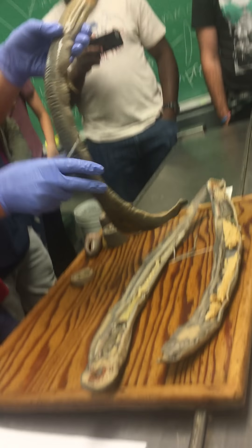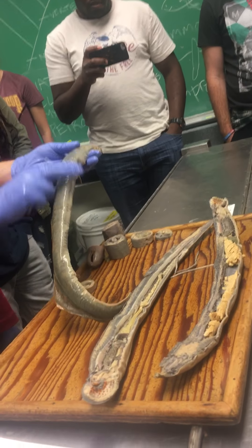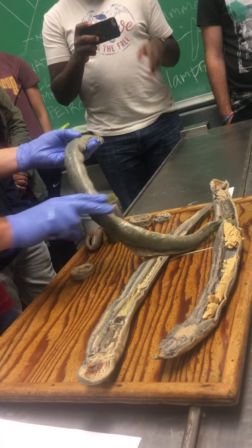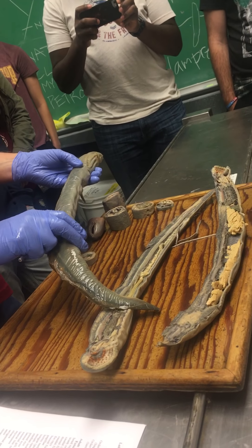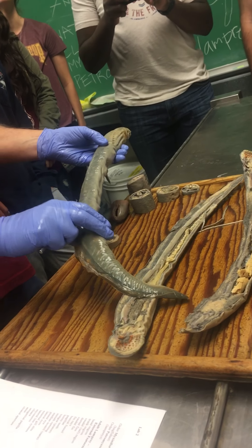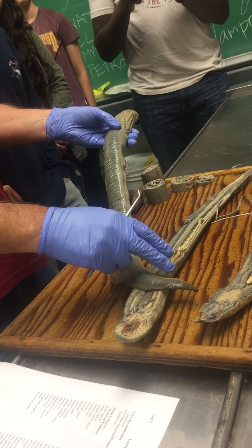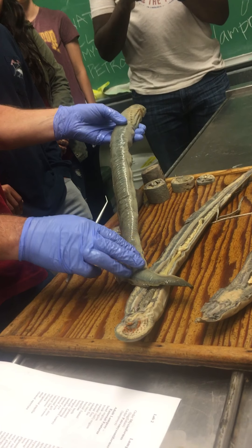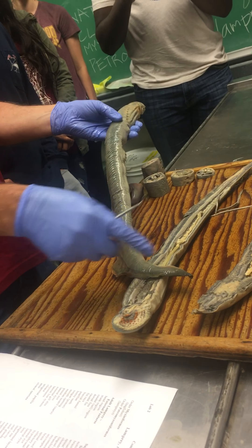The lamprey has a head region which goes all the way to the back of the gill slits. The branchial region is part of the head, and then the trunk region and a caudal or tail region.